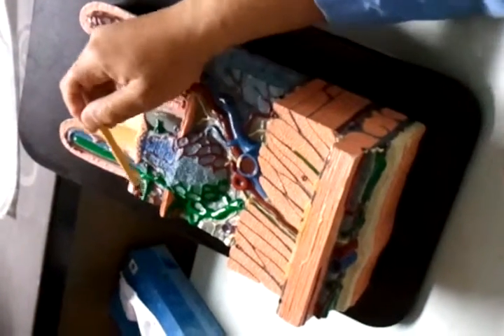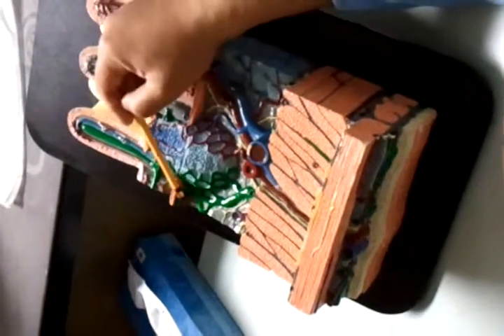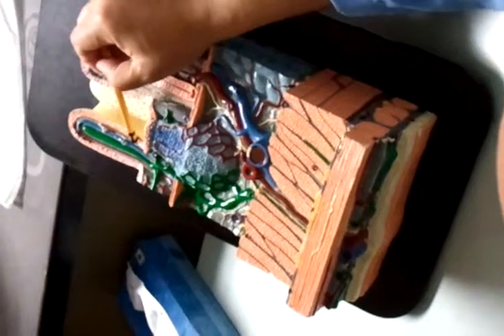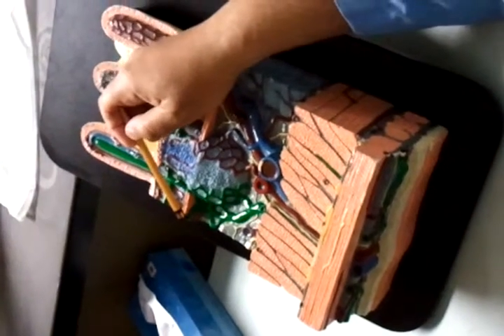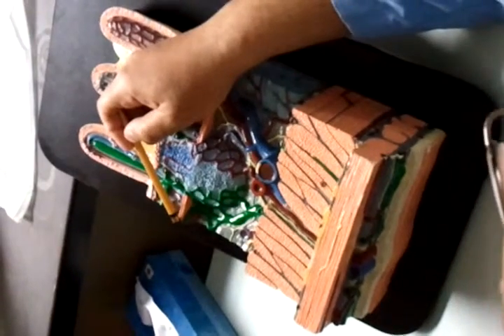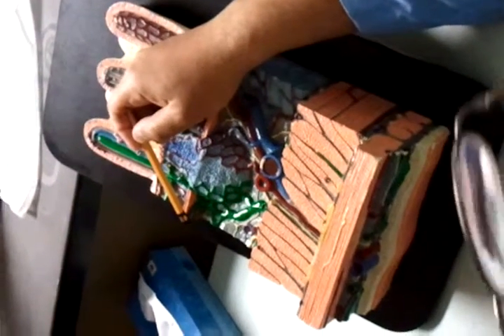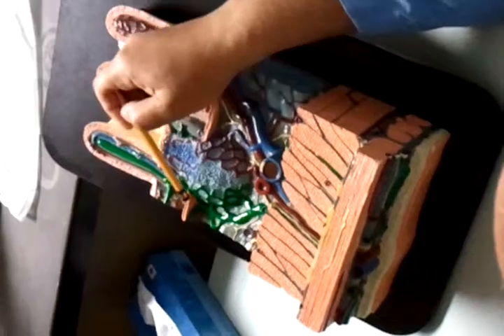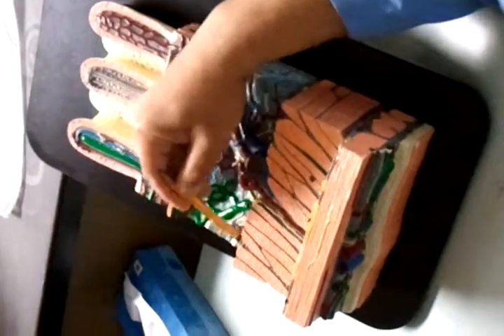And then, so we said we have 3 sublayers for the mucosa. From here to here is mucosa. We have 3 layers. Epithelium, which is the lining, simple columnar, then the lamina propria with the lacteal in them, and then the muscularis mucosae, right where I am now, which is the smooth muscle layer of the mucosa. Only this piece right here.